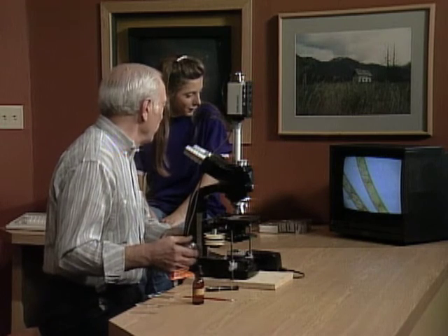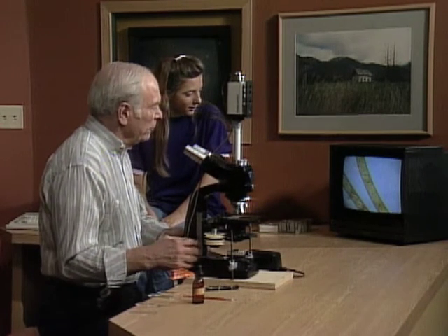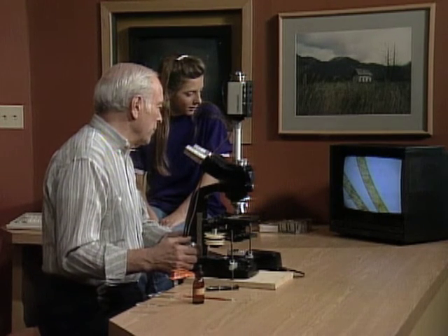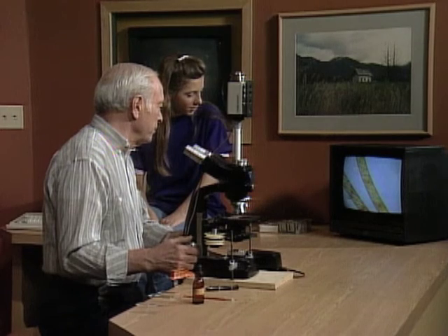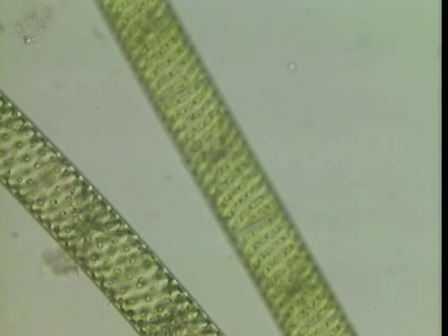Right, and it's not moving either, so it couldn't be an animal. The reason it's called a Spirogyra — did you see that little animal that went swimming by? Yes, right down at the bottom.